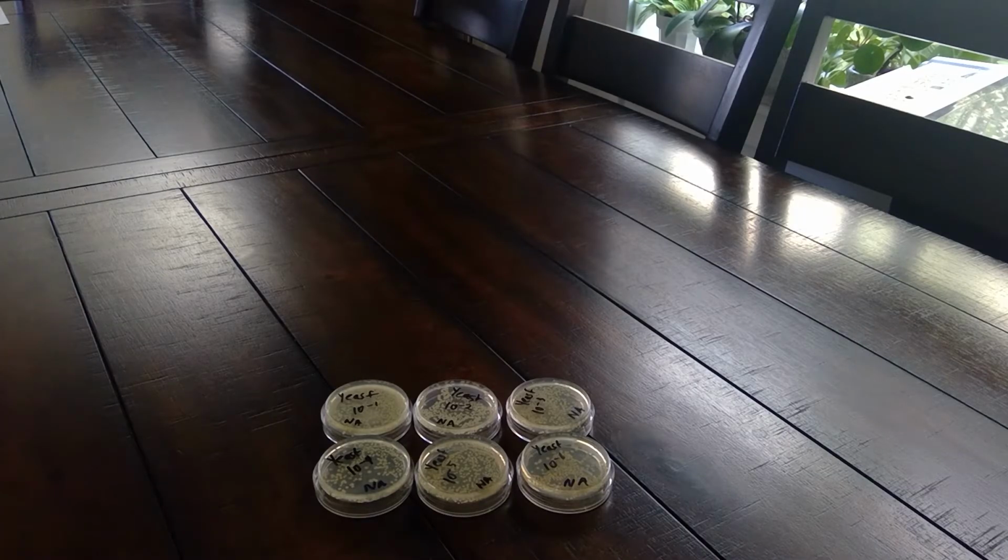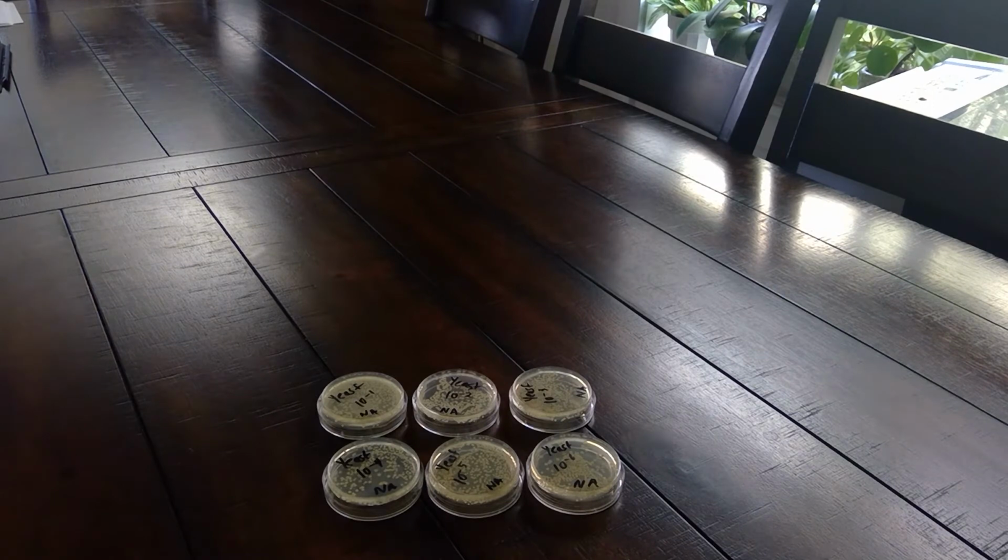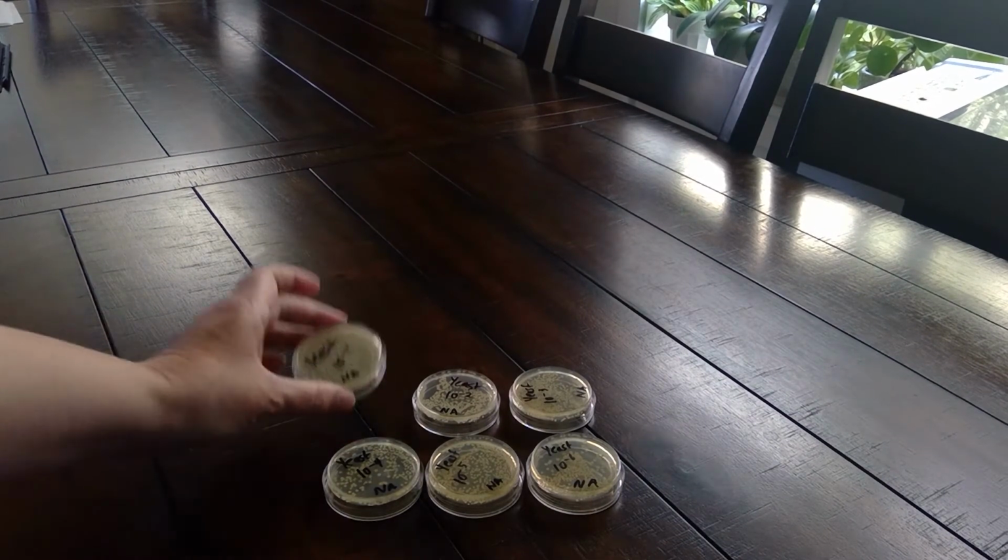All right, so it's been over 2 days. So I had checked on my yeast plates. I flipped them after 12 hours, and then I checked on them after 2 days, and they were not growing. So I consulted with Annie, and we decided to redo the experiment on the same plates. And so I redid the serial dilutions and then re-inoculated the plates. So your plates might not have as much culture on them.